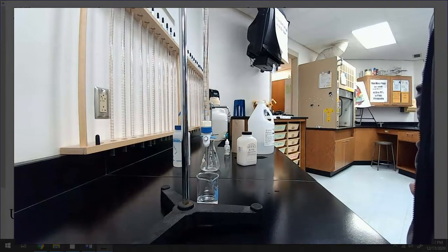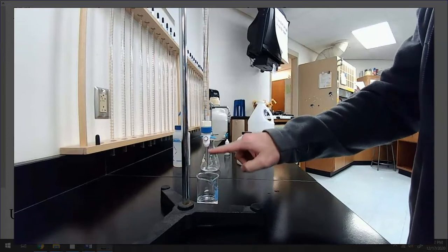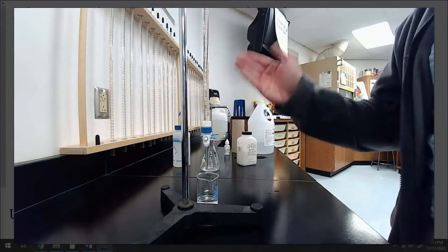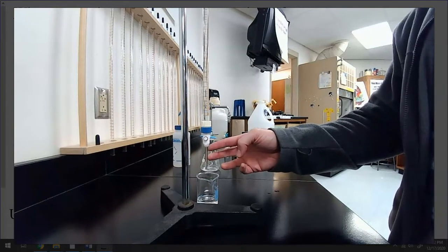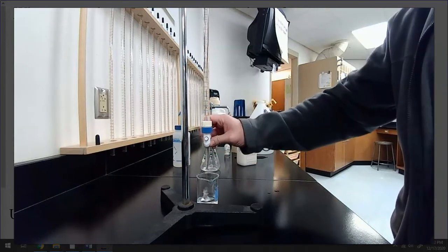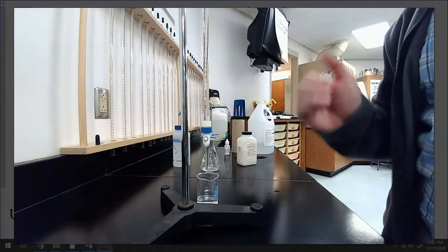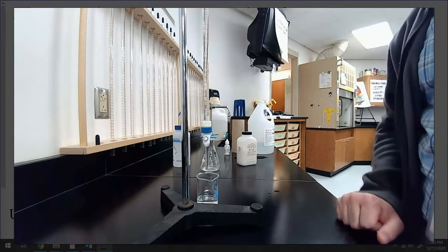Okay, now another mistake is sometimes there's a bubble down here. Okay? I rinsed this, and I think you can even see it actually. I rinsed this, and I opened it up, and I let it drain completely. But now, if I want to run my titration, I don't want that bubble there. That's going to screw up my volume. So I need to let that clear out. There we go. Now it's primed. Now it's primed, and I can read my volume, and I can start my titration and be confident that whatever volume it says that I'm adding, I've actually added.